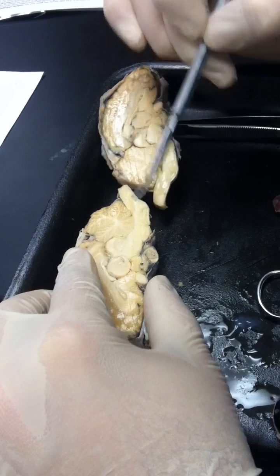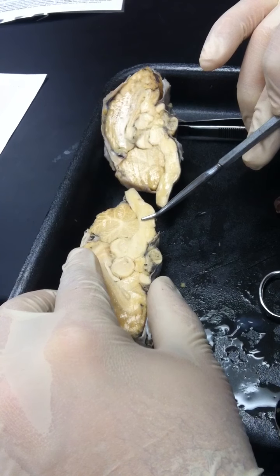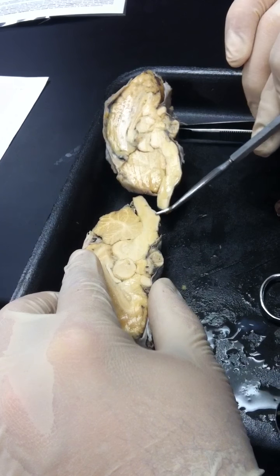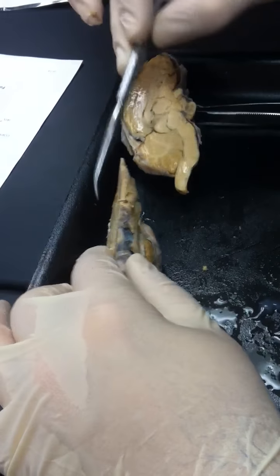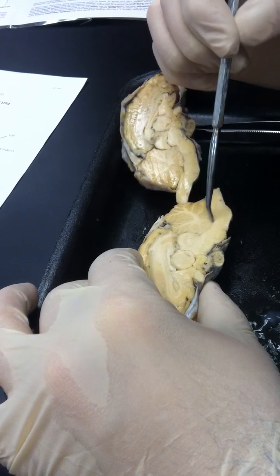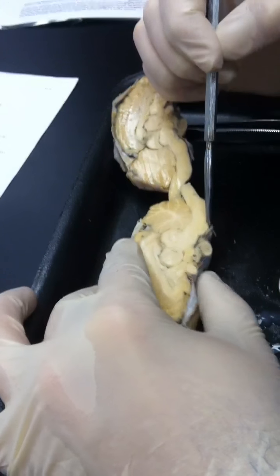Now notice, when you look at it this way, the spinal cord and the medulla aren't really any difference in thickness. The only difference is that when you hit the cerebellum, it looks like it's getting thicker from the outside. You see how it looks like it's getting thicker? But really all it's doing is just moving down, okay? Then there's a little bump, one more bump right here when you get past the cerebellum. That's the pons right there, okay?